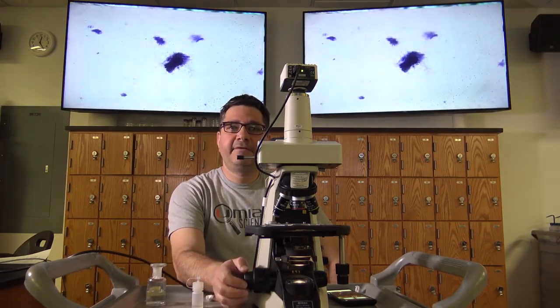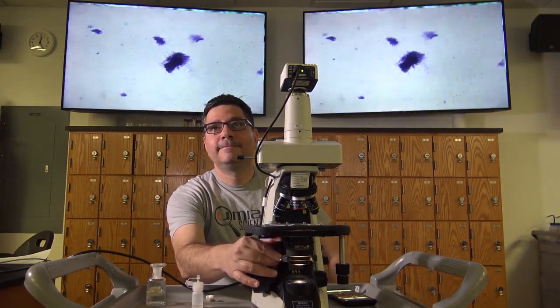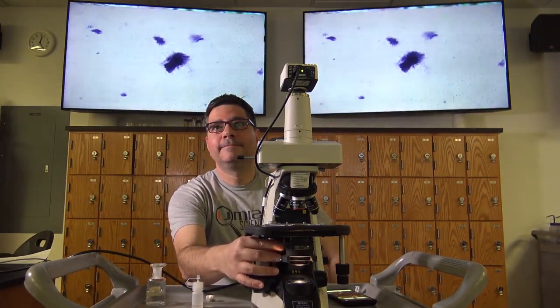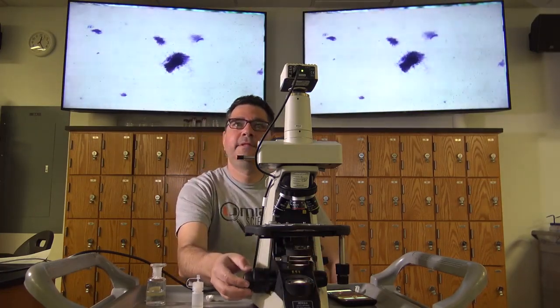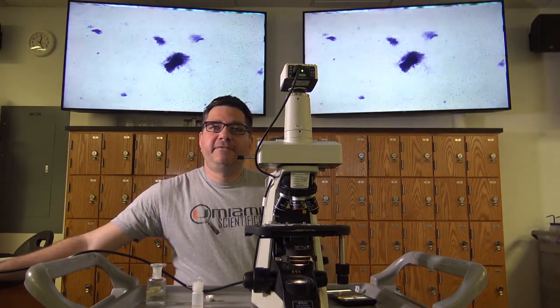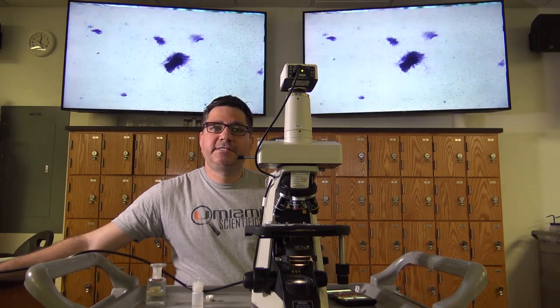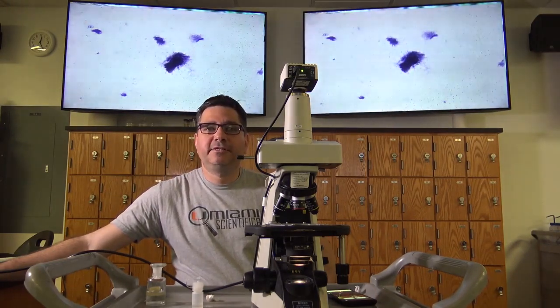Adjust the condenser and the diaphragm for optimal viewing, and fine focus. The diaphragm has the objective numbers printed on it. You should adjust with each switch of the objective, lining up the tab with the appropriate objective number, and adjust the condenser as needed. There are 3 ways to tell if you're viewing what is on the slide versus debris on the eyepiece or objective or light source.